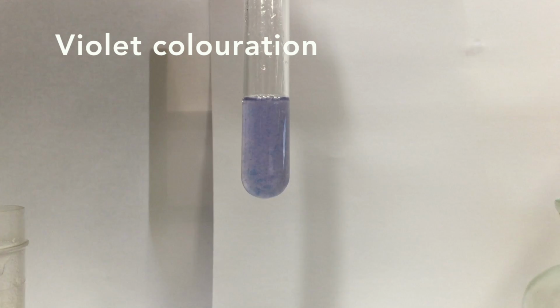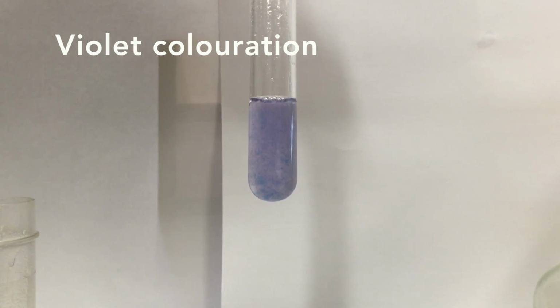We observe that a violet coloration appears. This indicates the presence of proteins.